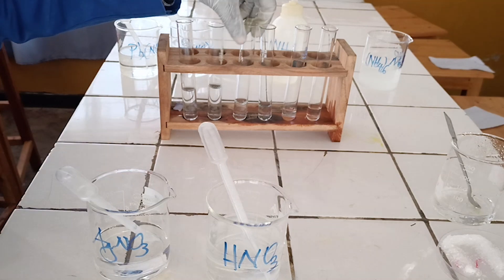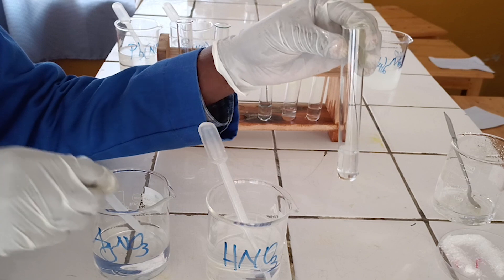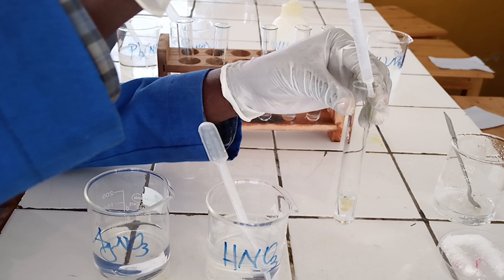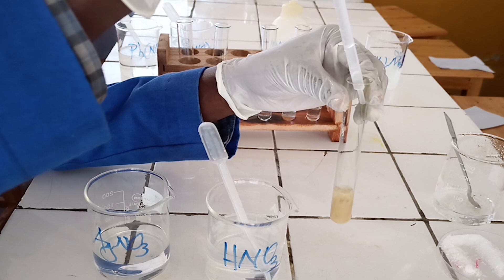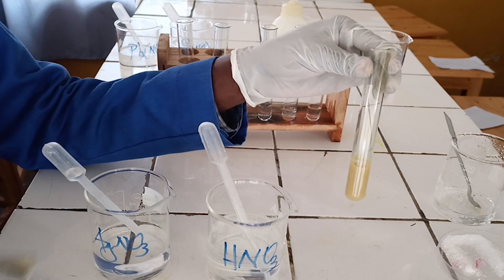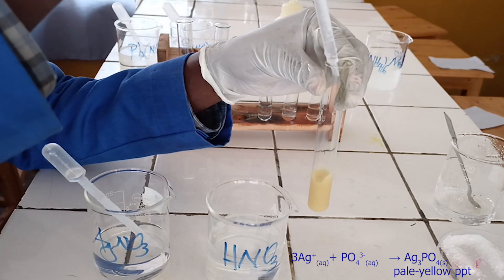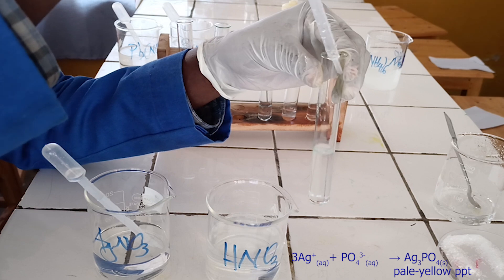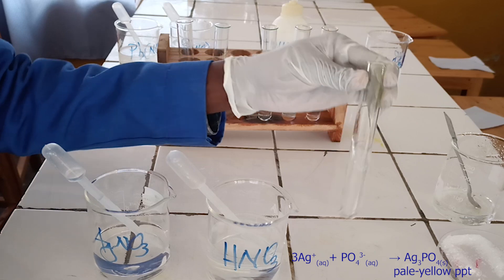To the third test tube, add silver nitrate solution followed by diluted nitric acid. As you see, silver nitrate solution reacts with phosphate ion to form a pale yellow precipitate. The pale yellow precipitate formed is soluble in diluted nitric acid without effervescence. Below, there is the ionic equation for this reaction.